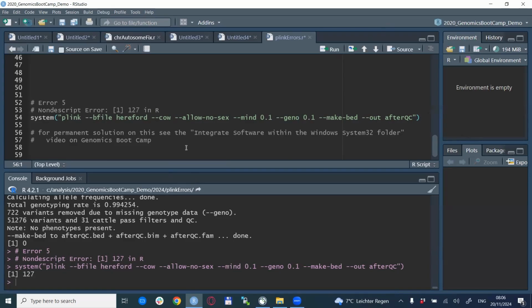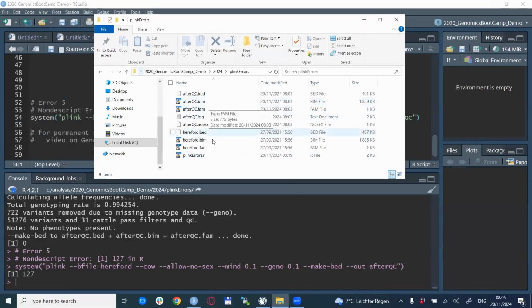Now, I engineered this setup so this error displays, but the reason for this is that I actually removed the PLINK executable from the working directory. So here you want to start an executable file with the system option in R, but that executable file is not there. So basically it just reports this error 127 and nothing else. If you see this, then this is to let you know that what you are missing is, in this case, the PLINK exe. But of course, if you try to run any other executable file with the system command and you don't have that file in the directory where R is looking for it, then you will get this small little error that doesn't really tell anything, but this is what it should tell.